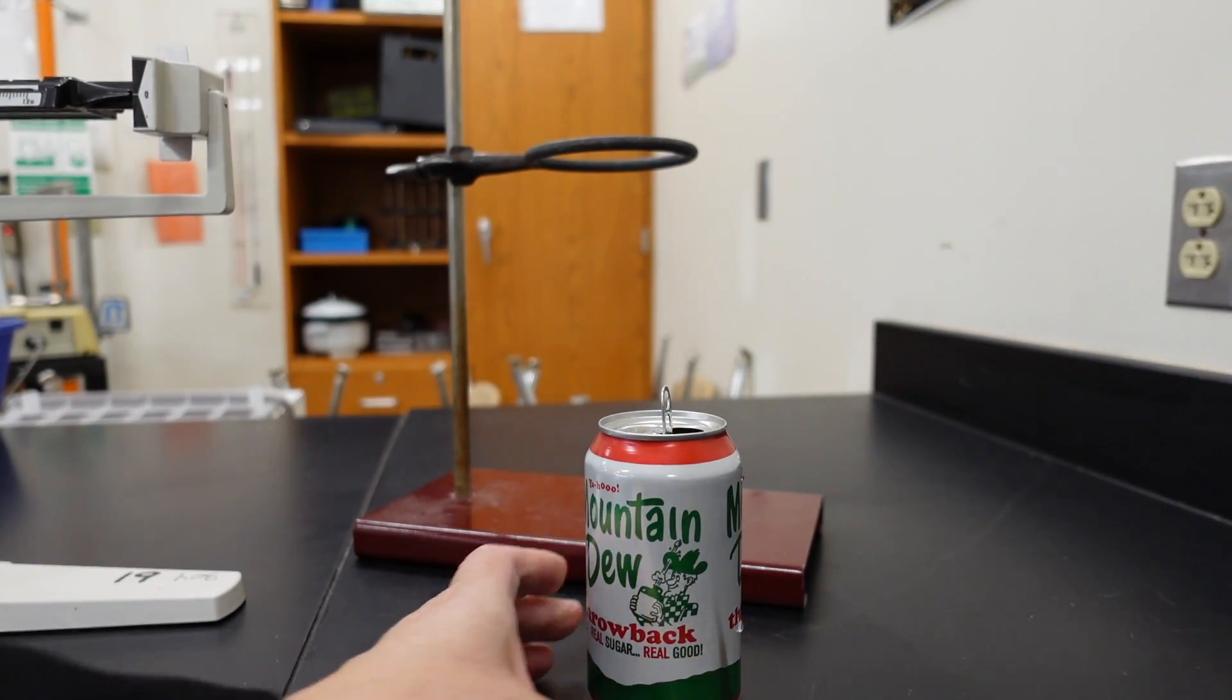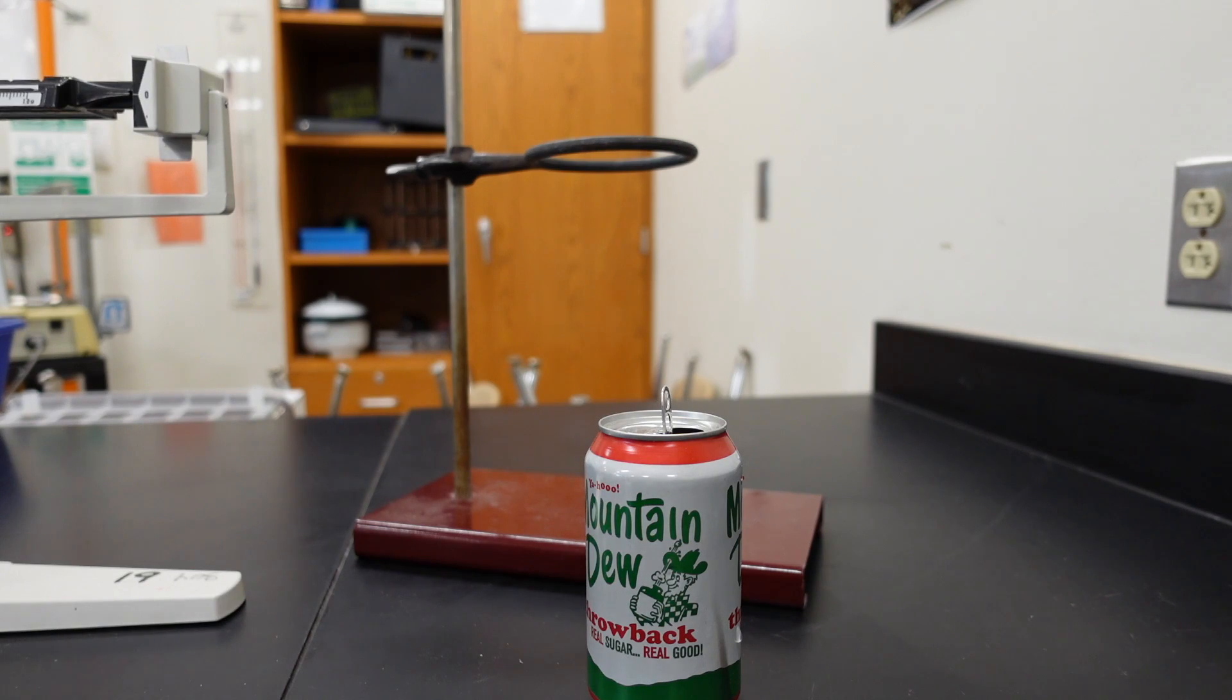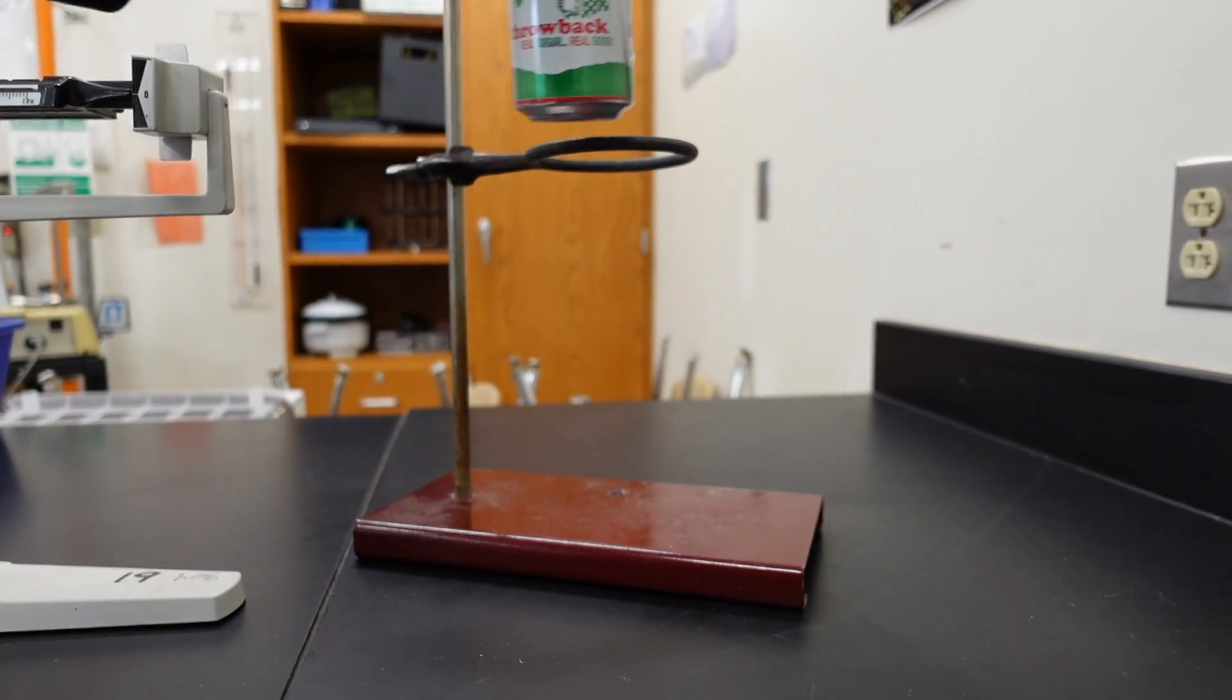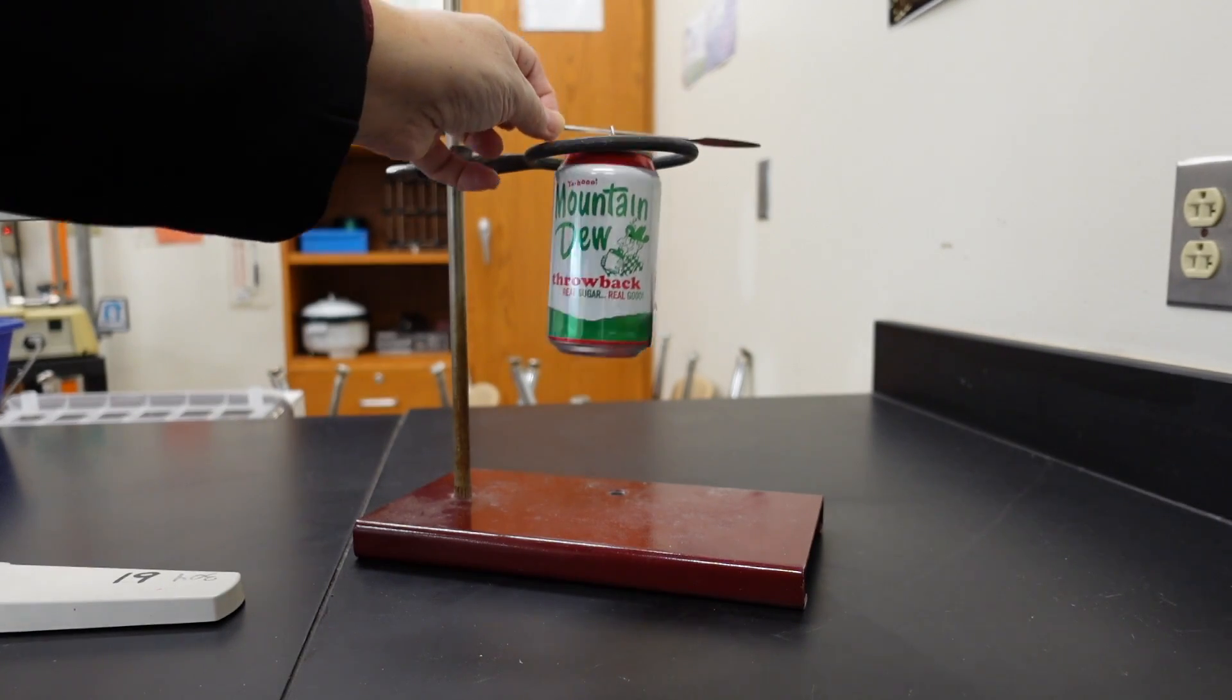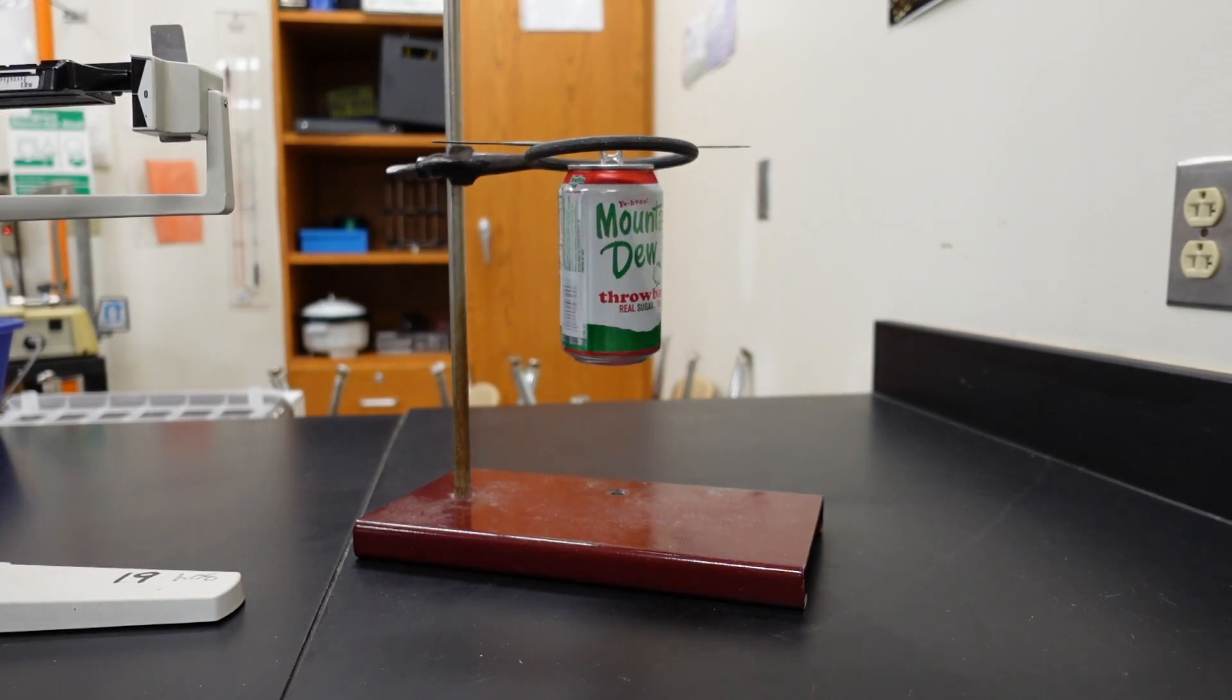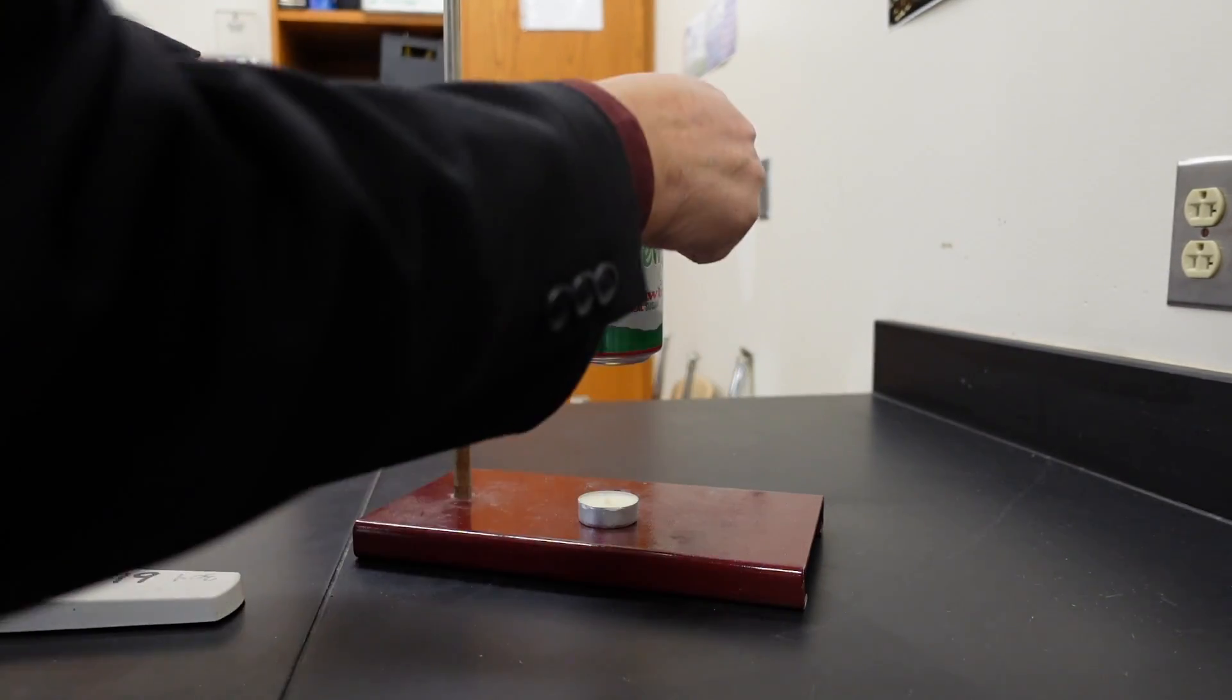We are going to take our can and we are going to add the water to it. Make sure it all gets in there.